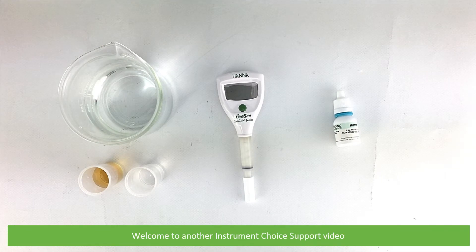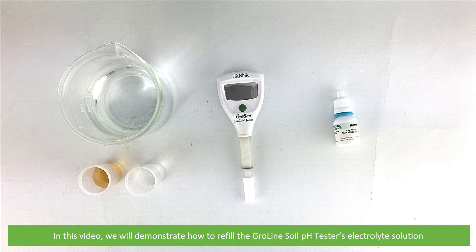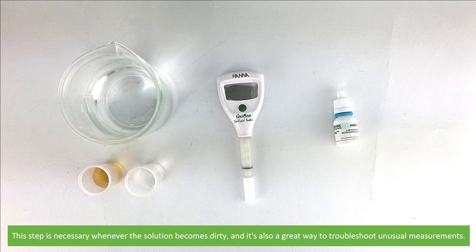Hi and welcome to another Instrument Choice support video. In this video we'll demonstrate how to refill the GroLine Soil pH Tester's electrolyte solution. This step is necessary whenever the solution becomes dirty and it's also a great way to troubleshoot unusual measurements.